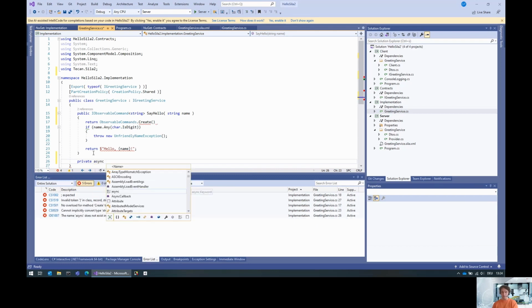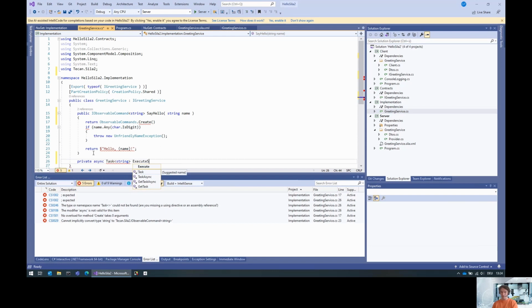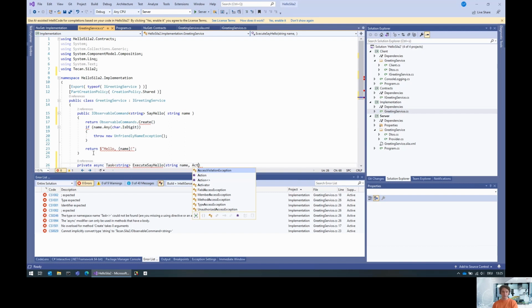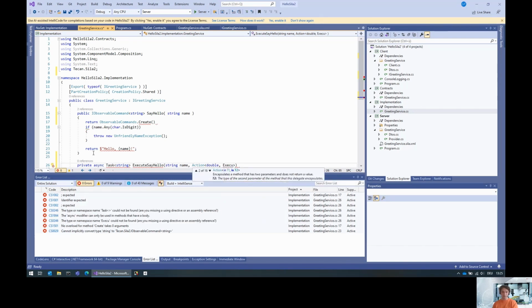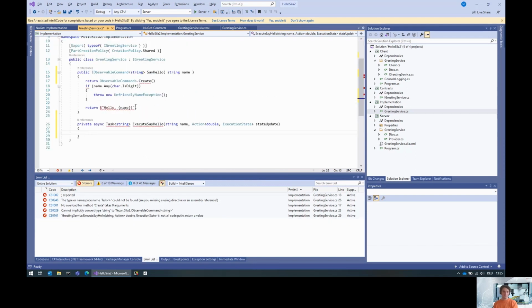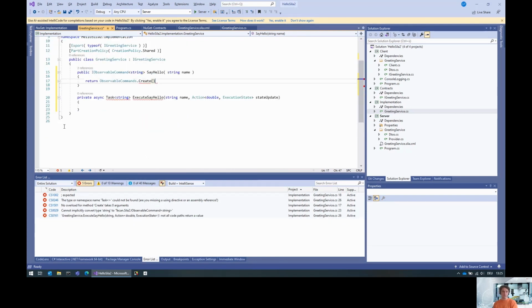So basically, we use the async and await pattern for this. We'll return a task of string and execute the say hello command with the given name and an action that takes in a double and an execution state. And now we can basically move this code here.